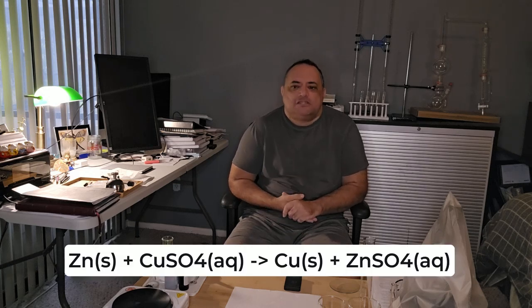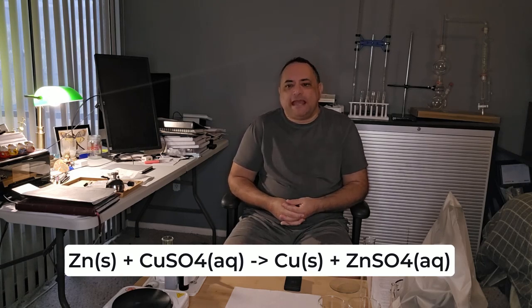In this video, we're going to study the mole relationship in a single displacement reaction where zinc replaces copper to form copper and zinc sulfate. Zinc metal is above copper in the activity series, and therefore zinc will replace copper in solution. The zinc metal is oxidized as it loses electrons, and the copper ions are reduced to copper metal as they acquire electrons.